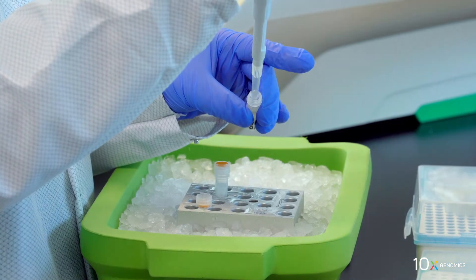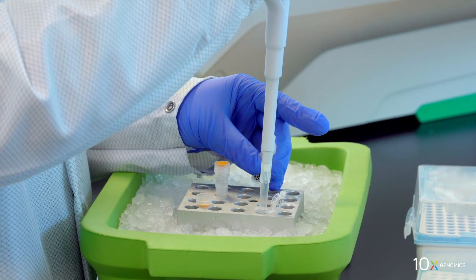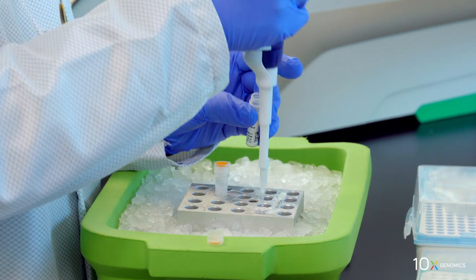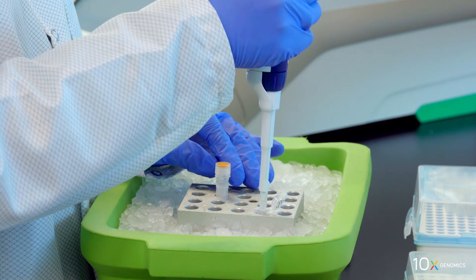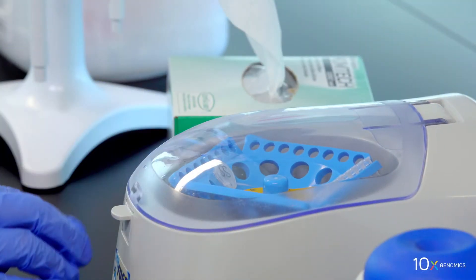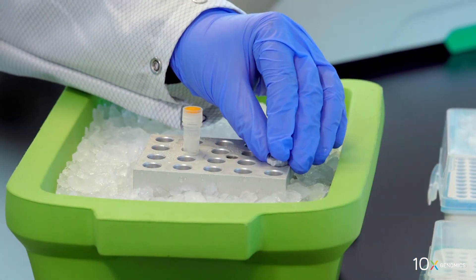We are ready to prepare the second strand mix on ice. Add the reagents in the order listed in the user guide. We add second strand reagent, second strand primer, and second strand enzyme. Vortex, spin down briefly, and place on ice.